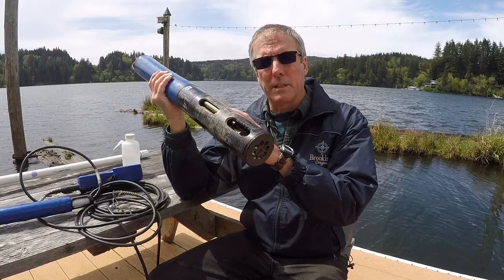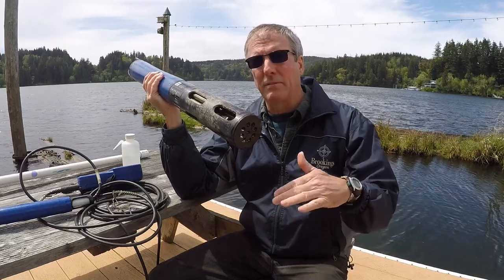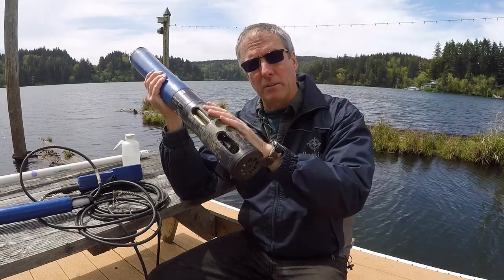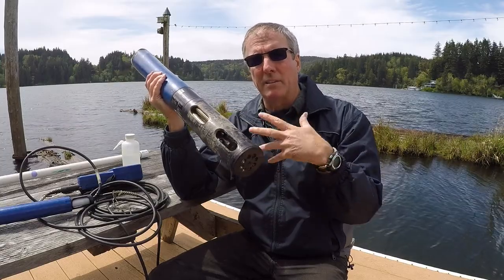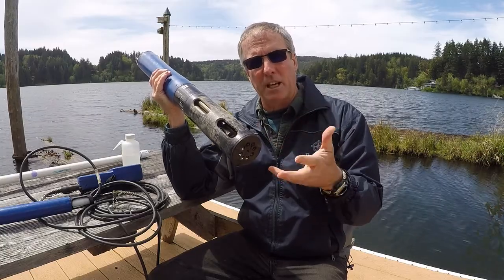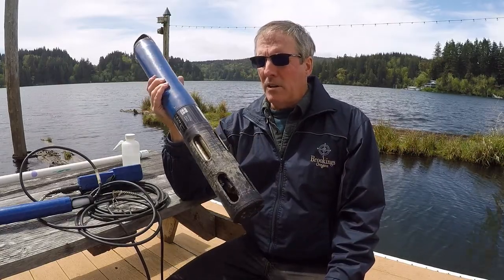If you have different probes in here, you can look for algae, chlorophyll A readings, and so you get a feel as you go throughout the summer how your algae is building up. Then you can relate that to the other readings that are on here, your pH, your DO, and your temperature, to decide if maybe those are correlated, so that as your temperatures and DOs change, that's what's promoting the growth of the algae.